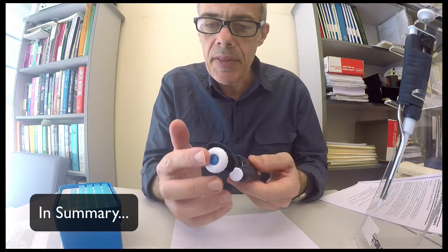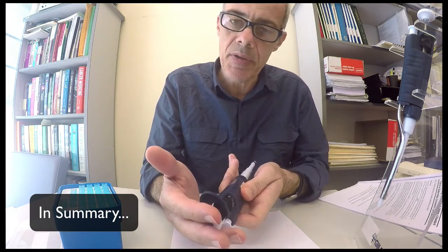And to help with confusion, have a look at the maximum volume it can dispense and what the maximum scale is. And then if it's a P1000 and it's showing a hundred, then obviously that 100 represents a thousand and therefore 90 represents 900.